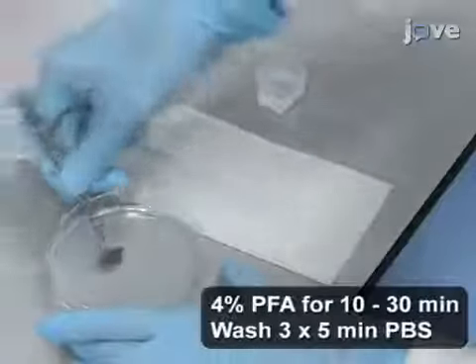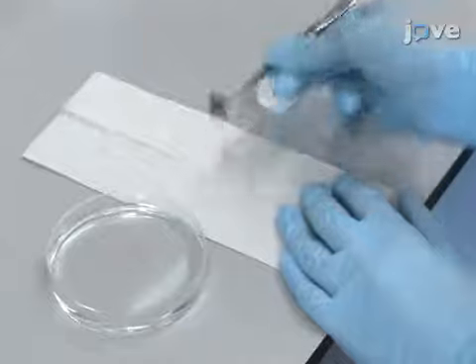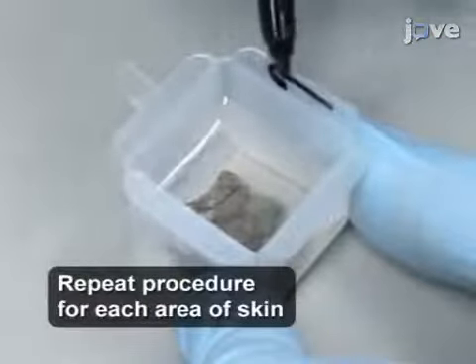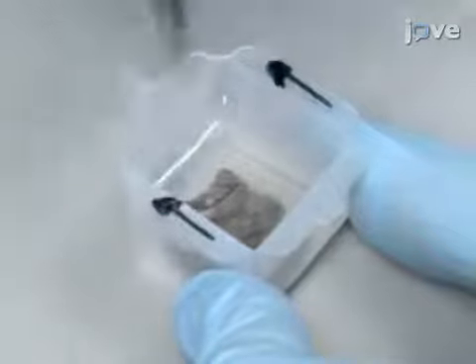After fixing, push the washed skin to the bottom of the OCT-filled mold so that it lies flush with the bottom. Mark the hair follicle orientation on the cryomold, as this determines the orientation of the cryostat cut.